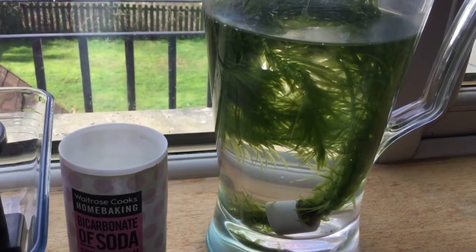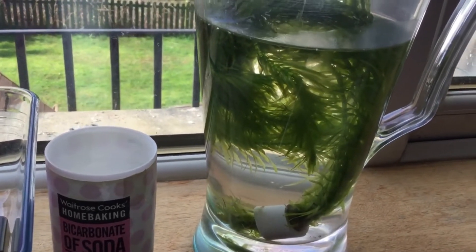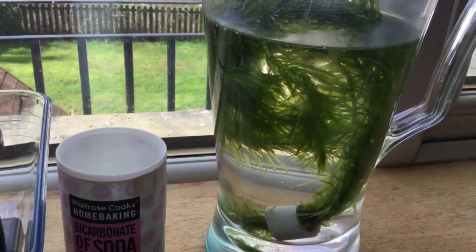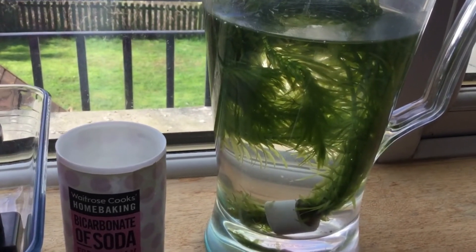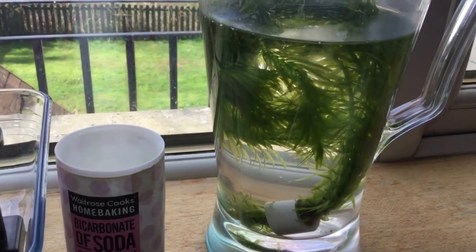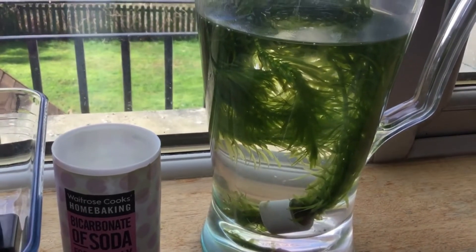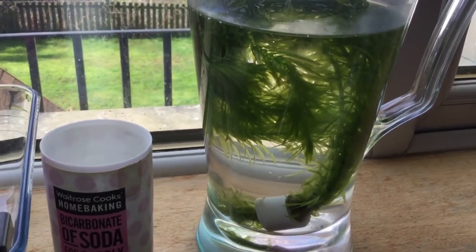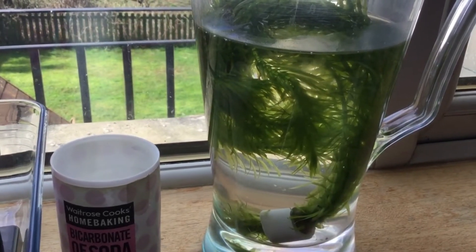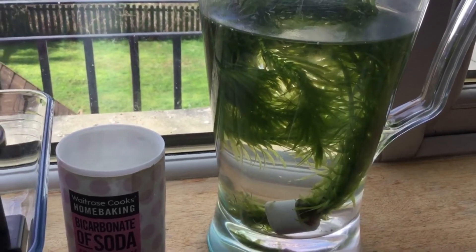I'm ready to go with the experiment. I have some water plants called Elodea — waterweed — which I bought from a pet shop. They're normally used in aquariums. The plant photosynthesizes underwater, which will make it easier to collect any gas given off.